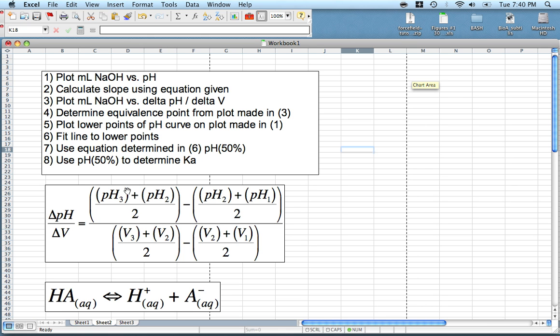So we're going to be able to do this in 8 easy steps. First, just plot the milliliters of sodium hydroxide versus the pH. Then calculate the slope using the equation given. That's this guy down here. Plot the milliliters of sodium hydroxide versus the delta pH over delta V. That's this. Determine the equivalence point from the plot made in 3. Plot lower points of the pH curve on the plot made in 1, and fit a line to lower points. Use the equation determined in 6 up here to determine the pH 50%. And then finally use the pH 50% to determine the Ka.